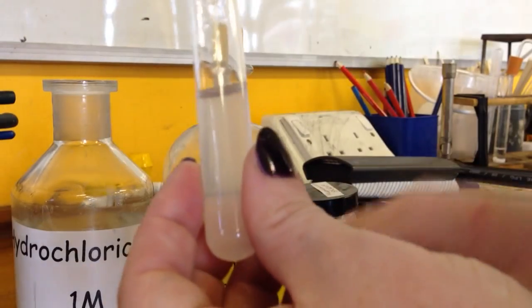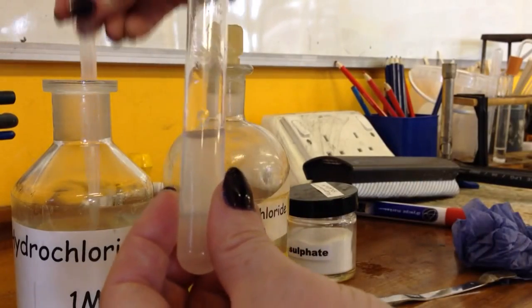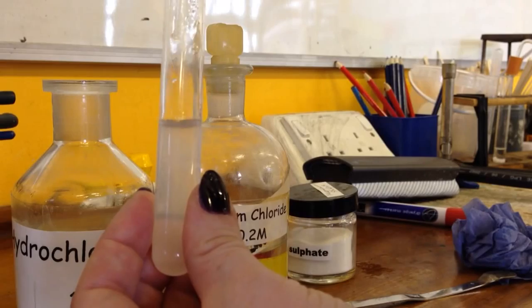Then I need to add in some hydrochloric acid. So you can see that it's a little bit cloudy but not very.